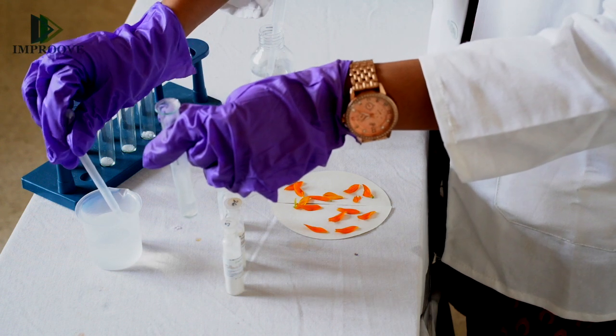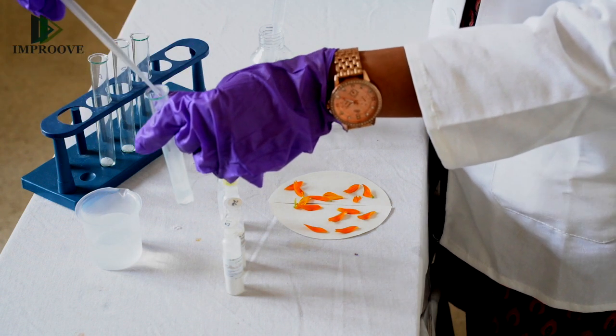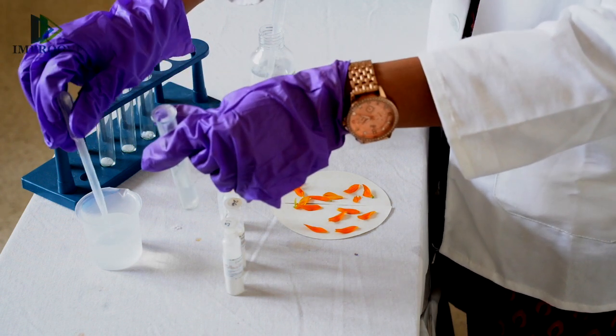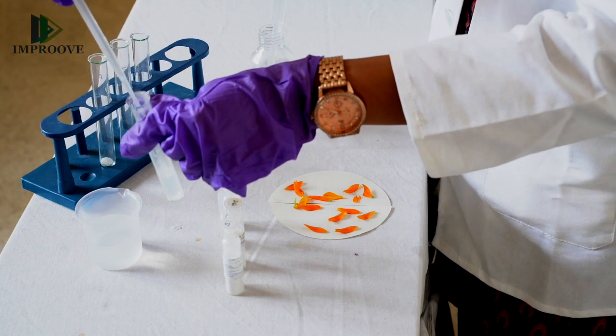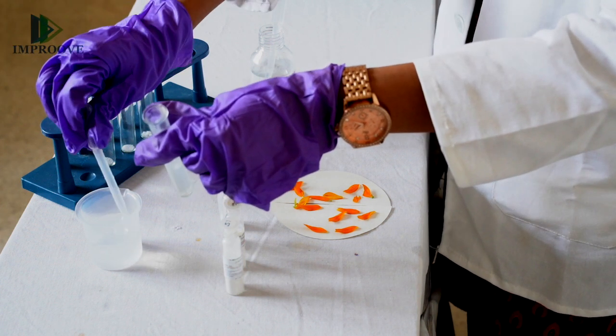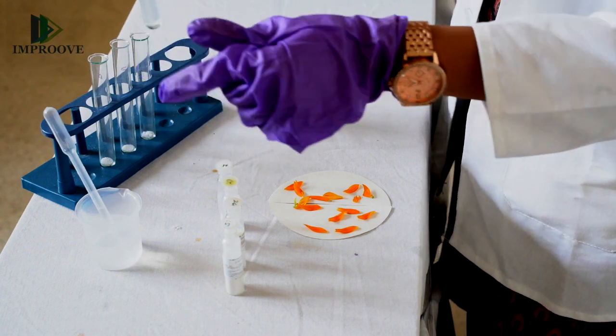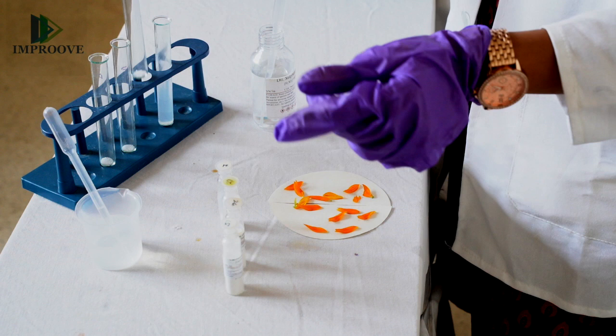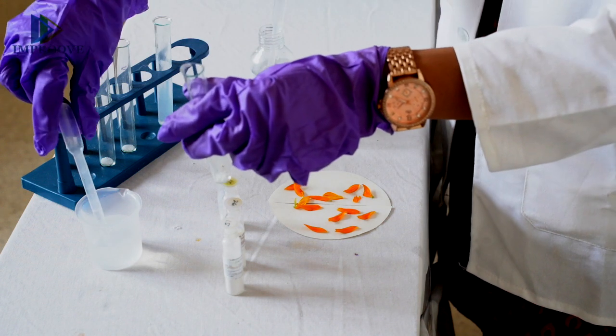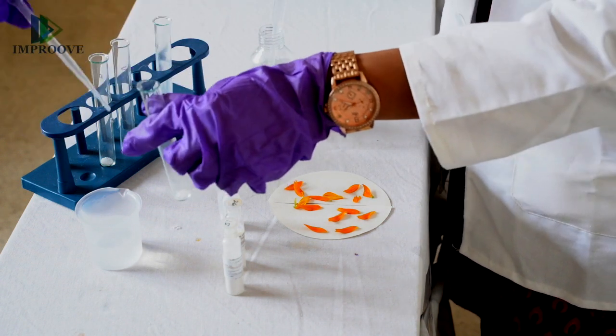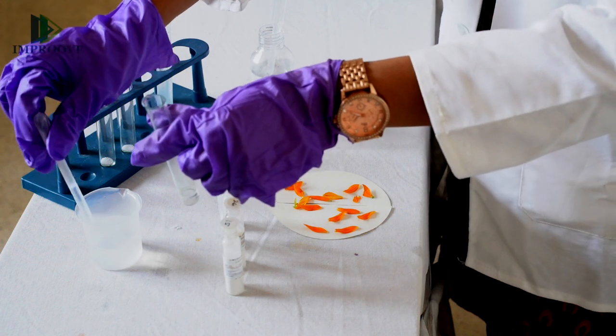Since you're dealing with dilute sulfuric acid which is corrosive in nature, you can wear gloves for safety purposes. Similarly, keep adding the water into the other test tubes.